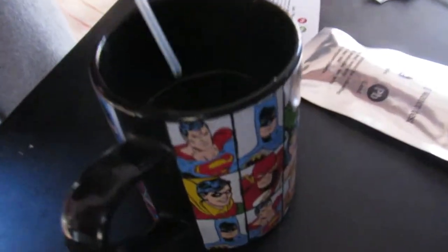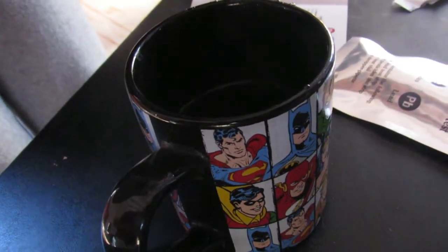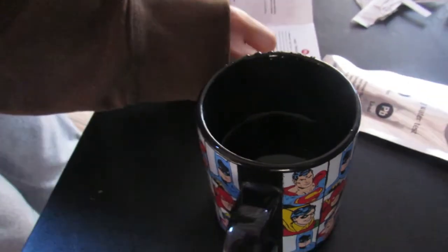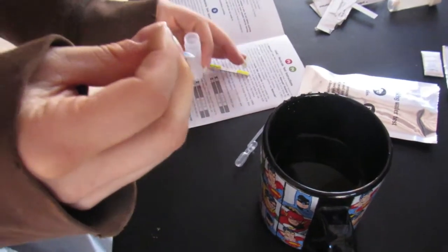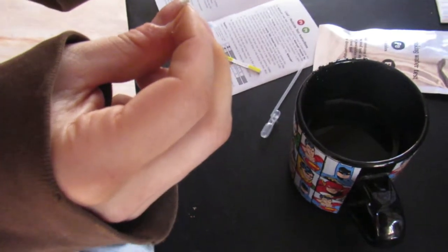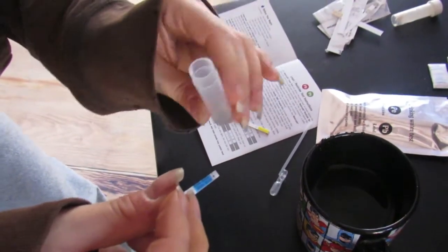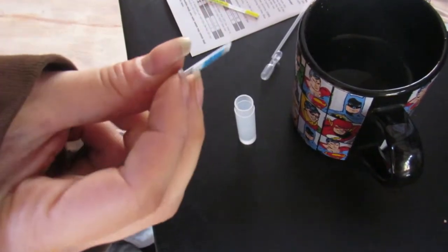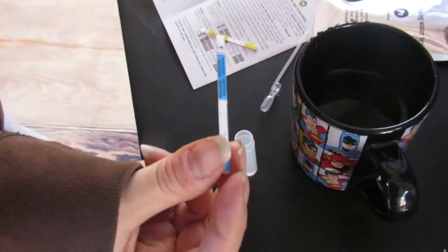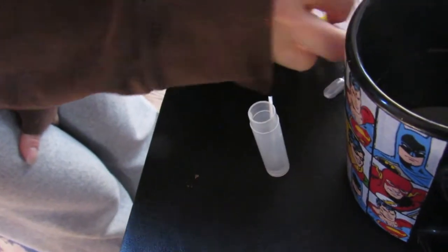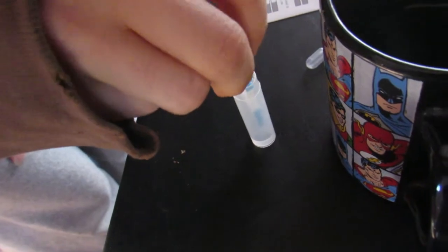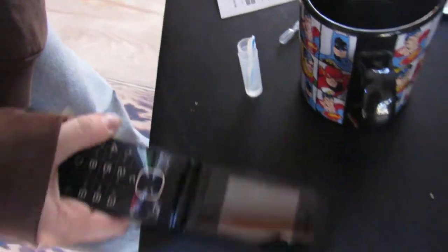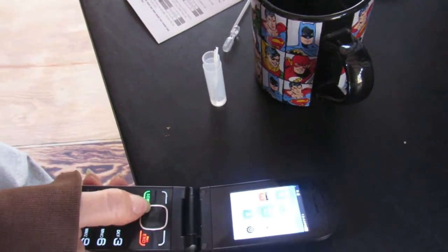So I got one. Two. Doesn't seem like very much. Swirl the vial gently for several seconds. Put it down where you're going to keep it. It's going to stay there undisturbed for 10 minutes, so make sure you're not going to be coming back and jiggling this around. Place both test strips into the test vial with arrows pointing down. There's my pesticide. Here's my lead. Keep them in there for 10 minutes. I'll get my timer going. And we'll let you know what the results are.